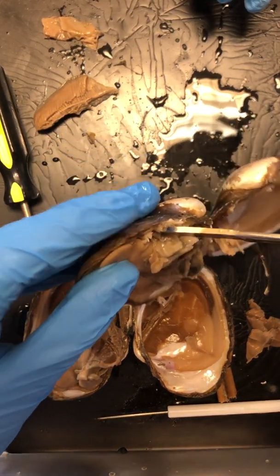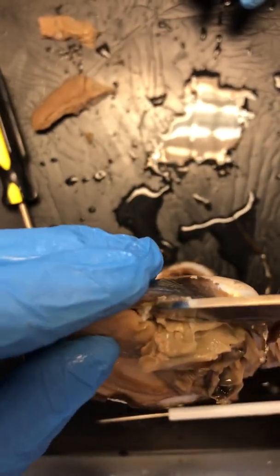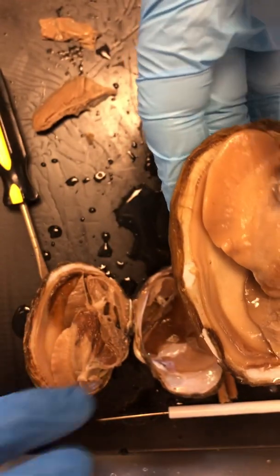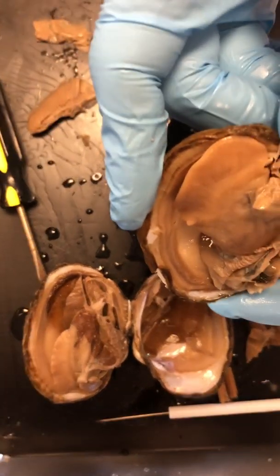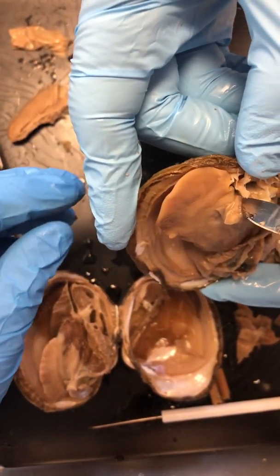Haha! All right, so it's a little tricky to see. It's actually really tricky to see. But your mouth, do you want me to hold it and you point at it? That'd be awesome. Thanks. Oh, awesome. Cool. Is that good? That's awesome. So its mouth is actually going to be right in this little gap down this way.